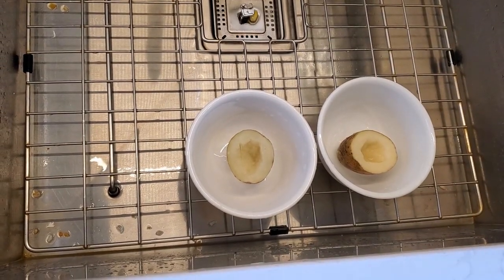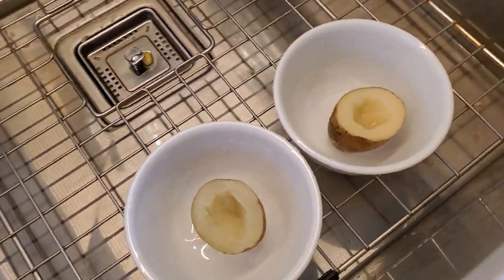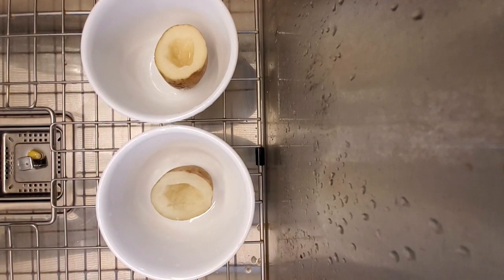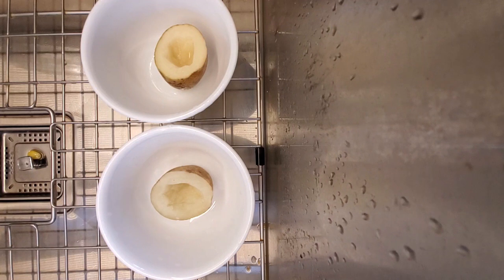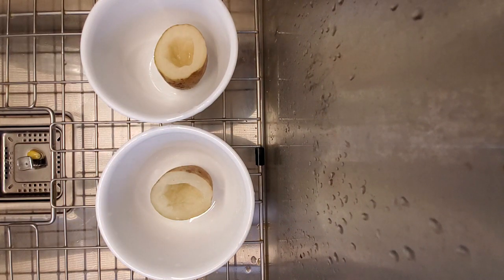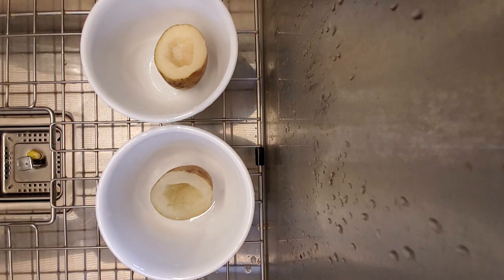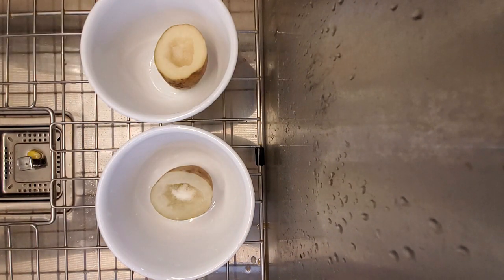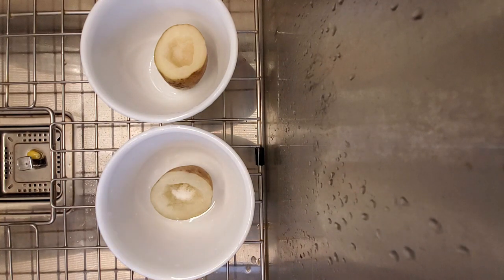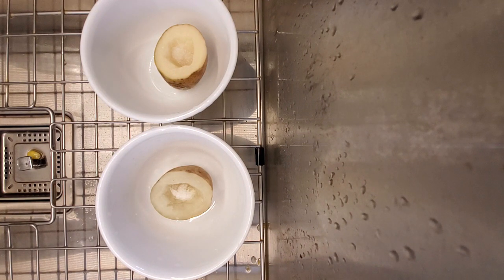So why did I set up two holes? I'm going to put salt in them now. As we know, when there is solute, water will diffuse from high concentration to low concentration. So I'm going to add some salt into the middle of each potato. You can clearly see I added some salt. Water goes from high concentration to low concentration, and wherever there's solute, water is going to want to diffuse over to where the solute is.